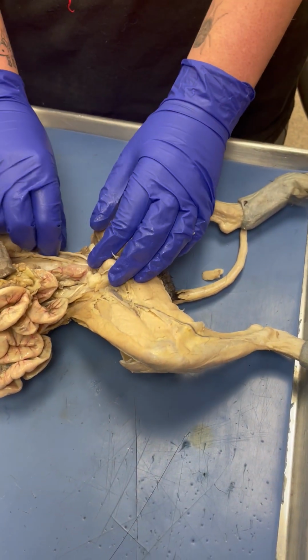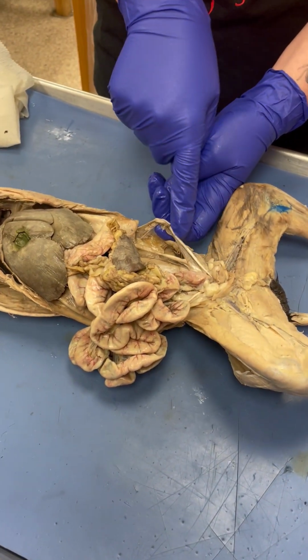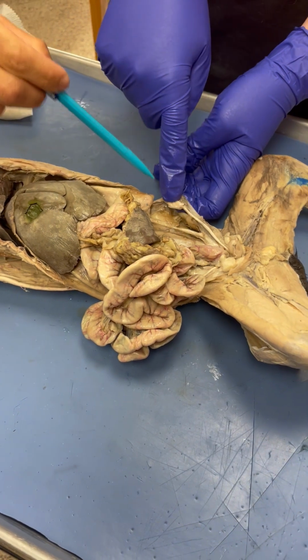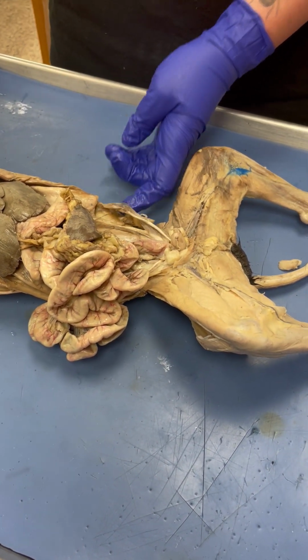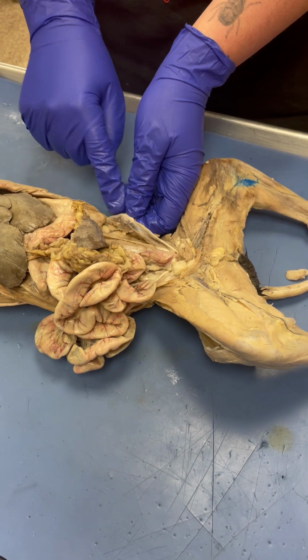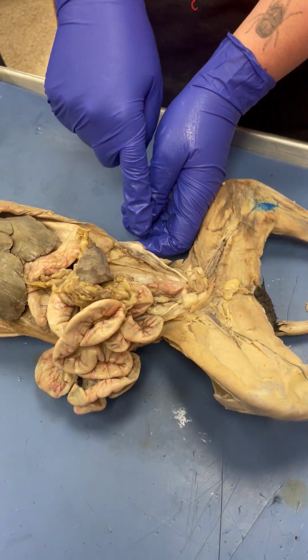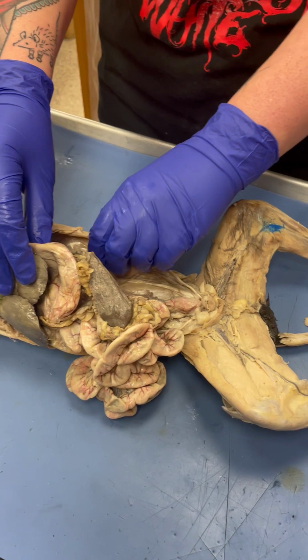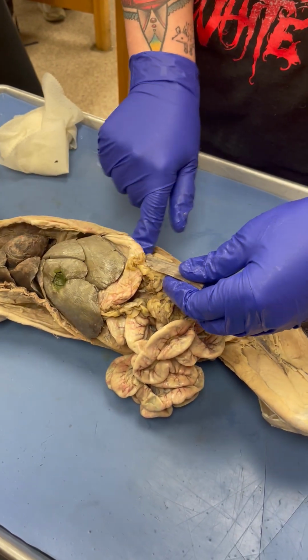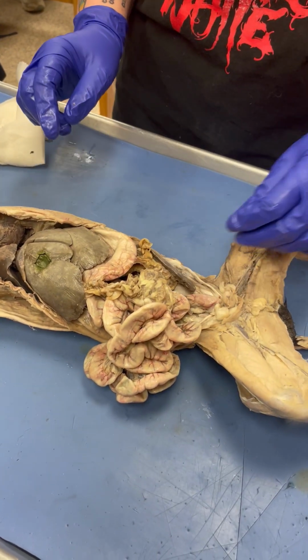Okay, so that's urinary. Reproductive, what is this structure right here? That's the ovaries. This is the uterus. No, this uterus is the ovary. Ah, that's right. That's like the egg. So uterus, ovary. Just really important when you're looking that you watch where that tube goes, because when these both are pinned, they look very similar, but that's the ureter and that's the uterus. So just make sure it's attached to the kidney, or attached to the ovary. Gotcha. Okay, and then what organ is this? Liver. Wait, no. This is the liver. This is the spleen. But that spleen looks so different.